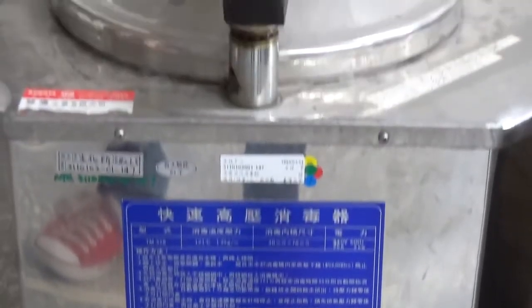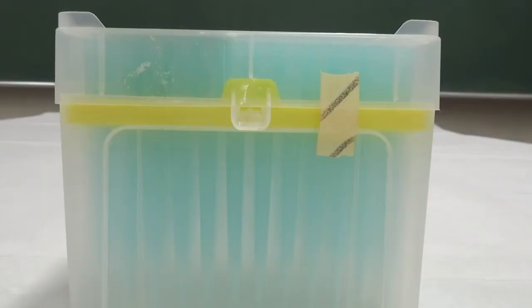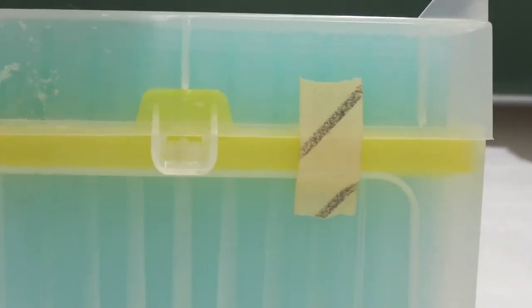For molecular biology experiments, the tips must be autoclaved and the tip box is labeled with autoclave strip for distinguishing.